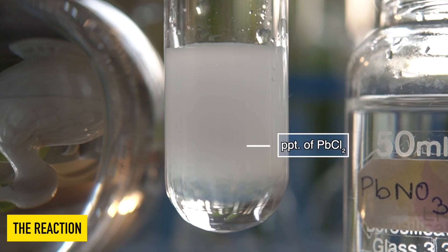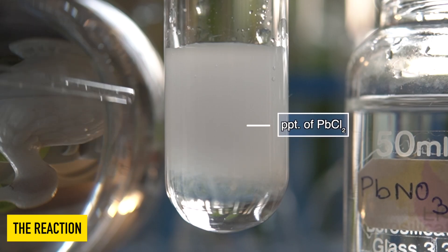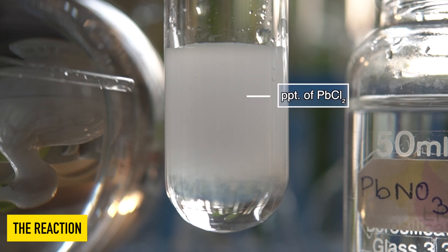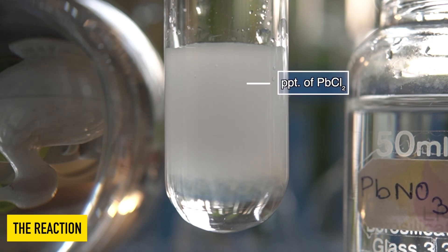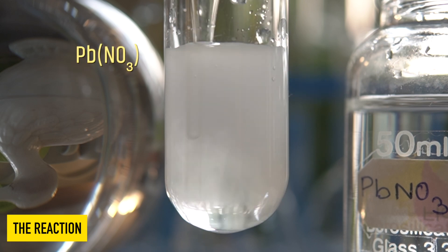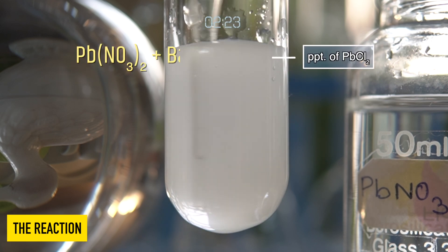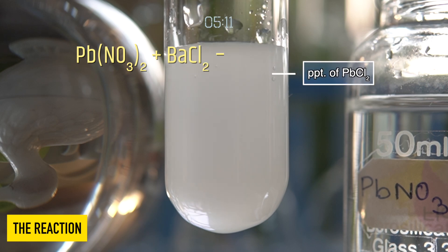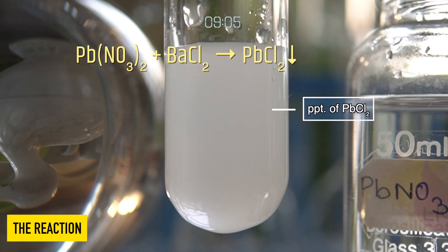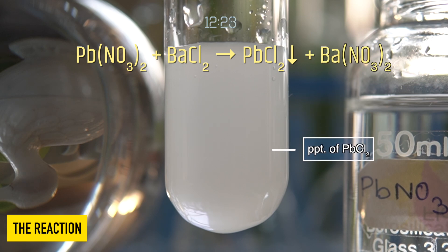The white insoluble precipitate that has been formed at the bottom of the test tube is nothing but lead chloride. So in this reaction, lead nitrate reacts with barium chloride to produce an insoluble precipitate of lead chloride along with barium nitrate.